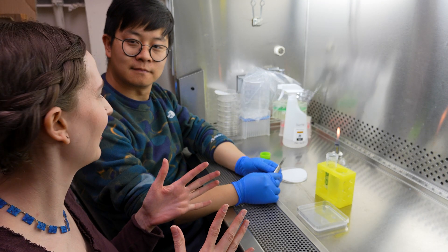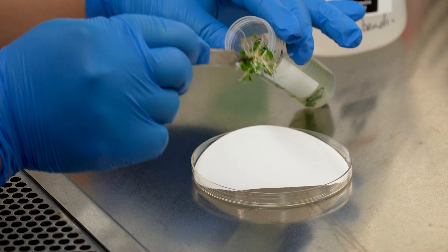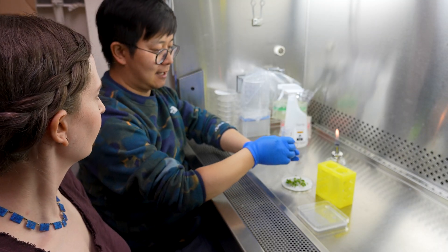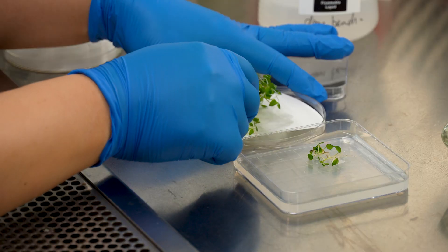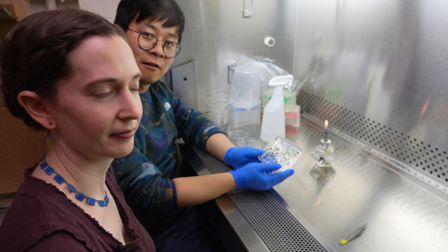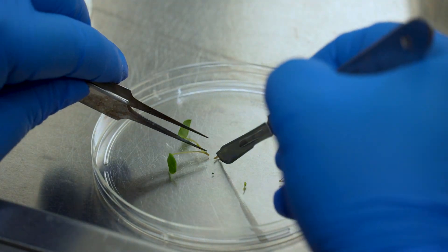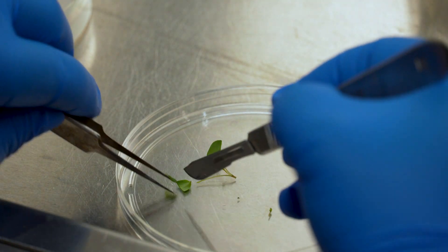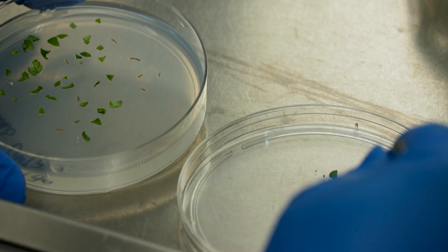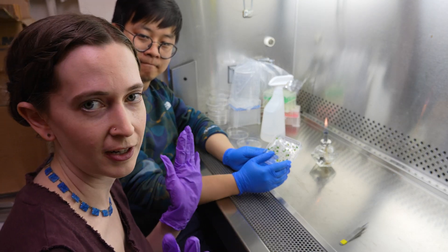So now that our seedlings have had all their Agro vacuumed into them, what happens now? Now we're going to take them out of the solution and let them chill for a couple of days and let the bacteria do its magic. This process is basically like when you are baking bread — you let the yeast sit with the dough for a while; they need time to do their thing. Now this is the batch I did transformation on two days ago, and they are done with their resting. Now I'm going to chop them into pieces, and those little pieces, with the help of a hormone, can regenerate into whole plants. This is a standard procedure that many transformation protocols rely on to make transgenic plants.